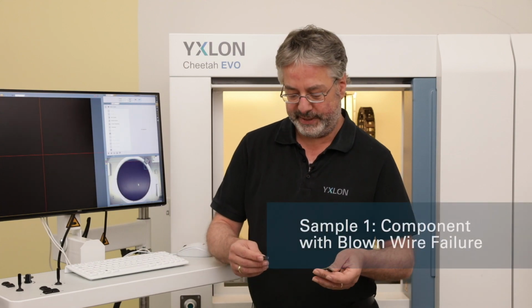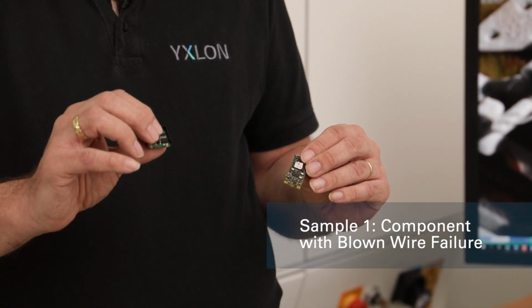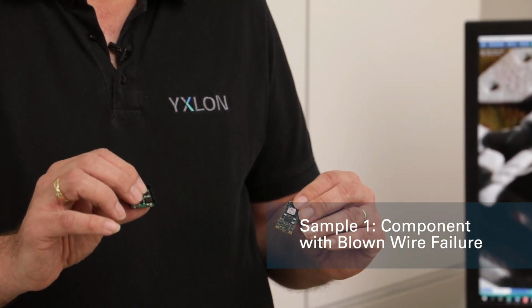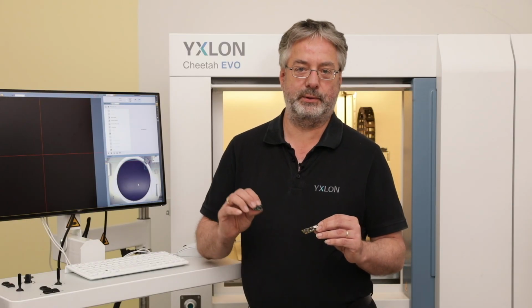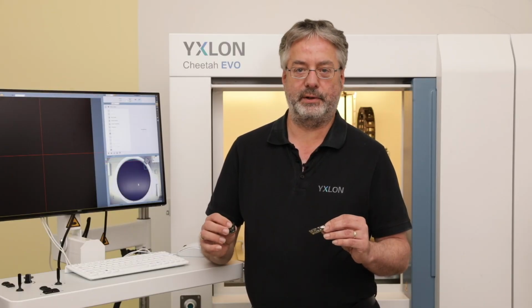For this I have prepared two samples here. One is a blown bond wire. This you can see also in 2D, but for the first sample it's easy to use and it's easy to explain what I'm doing with the CT volume, how to do the visualization, how to set up the reconstruction with all the algorithms and so on.